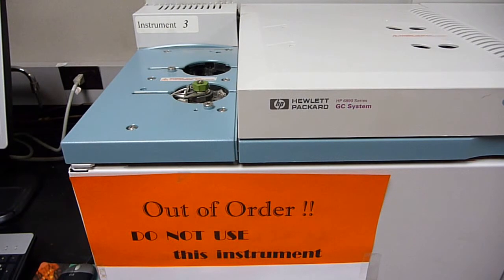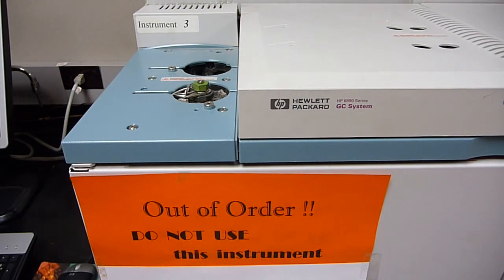Also in this video, we show a solution to keeping the room comfortable for human beings by using a hot oven exhaust deflection and removal system. Yes, an oven exhaust deflector is available from Agilent. However, one can modify a commercially available 6-inch elbow and achieve the same effect. And the cost of a 6-inch elbow is roughly only $10 in the U.S. In any exhaust venting scheme, it is highly advisable not to generate any additional stress on the oven flapper door assembly. I use the term for this desired design as open split. However you describe the design, remember, no additional stress in the form of continual suction on the oven flappers and thereby on the oven flapper motor.